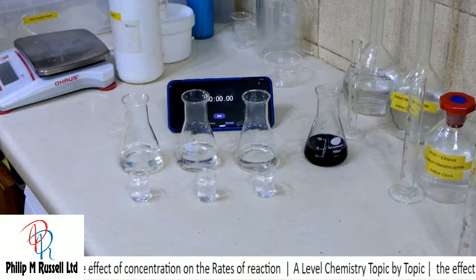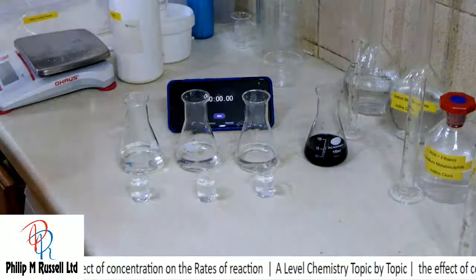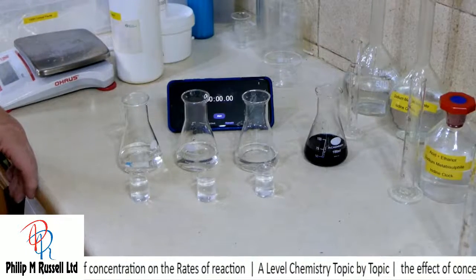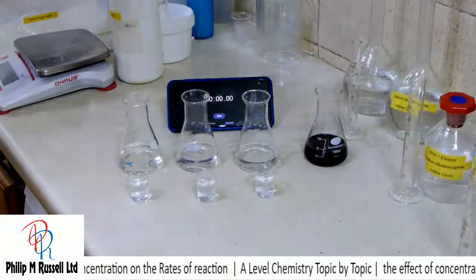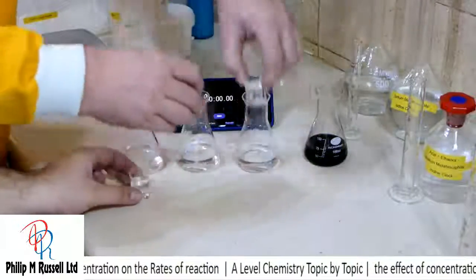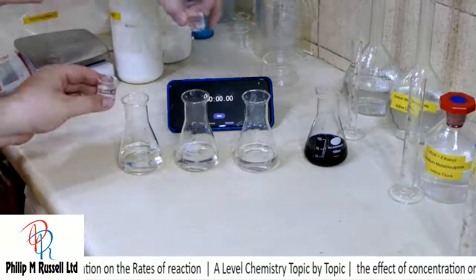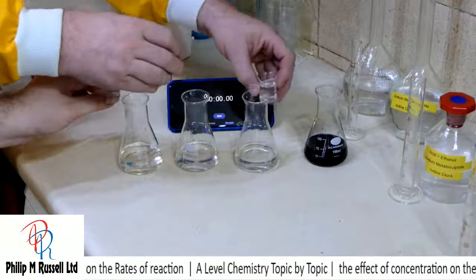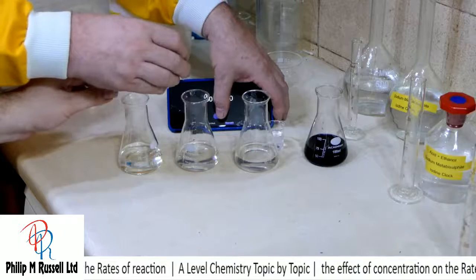So what I'm going to do is get my son to help me just put this in, because I can't do it unfortunately by myself. And we're going to have the 3 beakers in. So we want to do a start and pour.